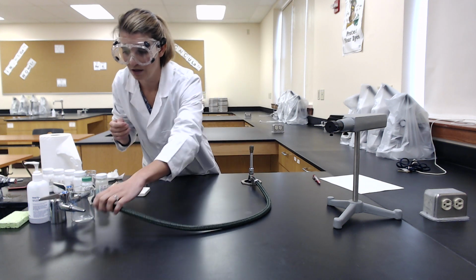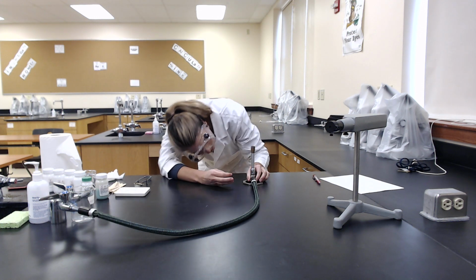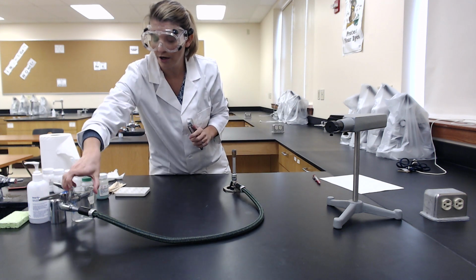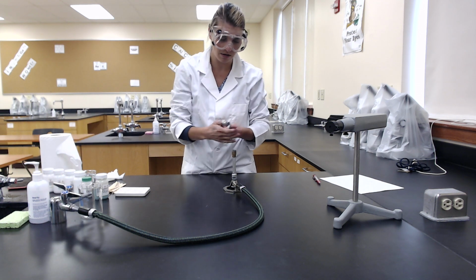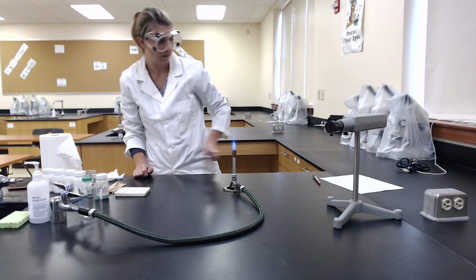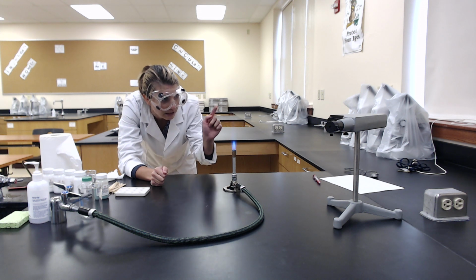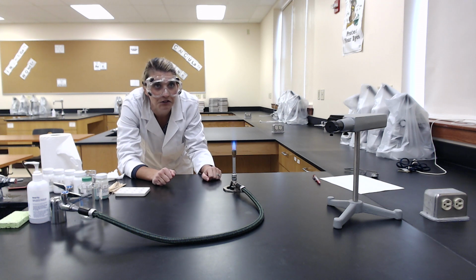Our gas is turned on. We want to put our burner on and make sure that it's adjusted well. We've got our flint. Turn our gas on. Hold it to the side and light it. So this looks good. We want a nice blue inner cone flame and as limited amount of orange as possible. So first shot, pretty good.